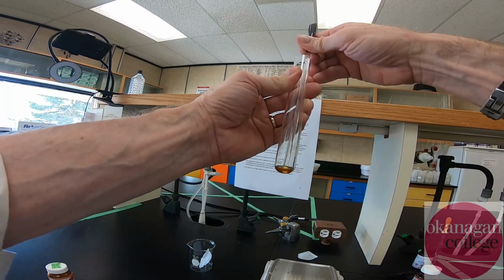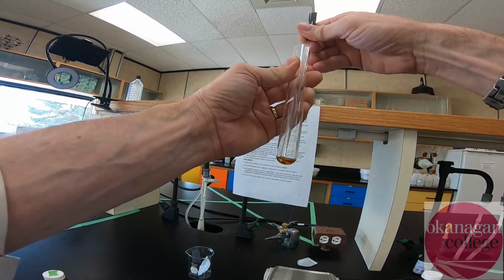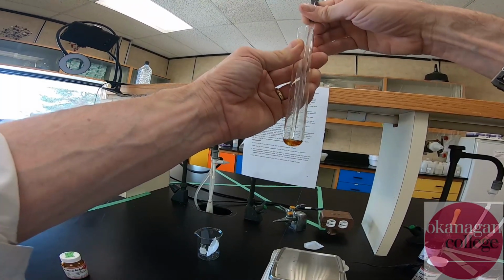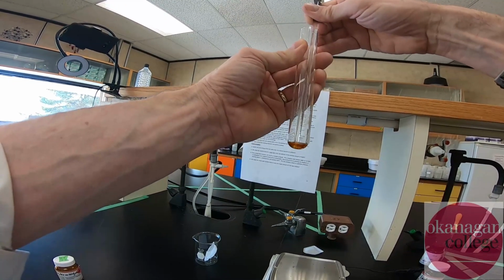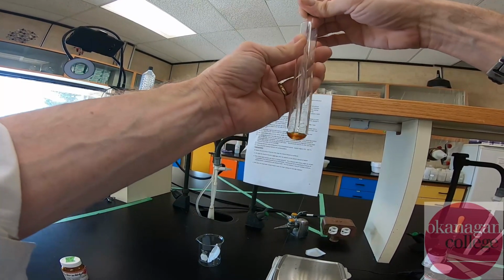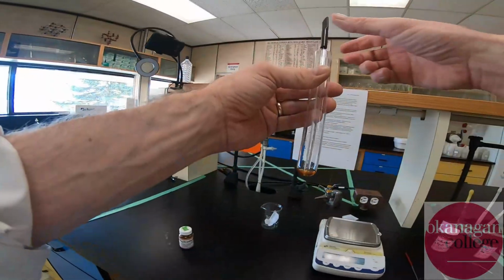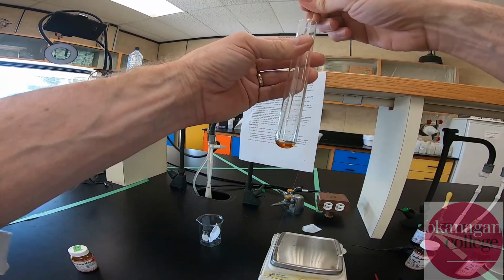We've got a clear brown oil with a small amount of solid material in the bottom of the test tube. It's important that everything be fully dissolved before we add the catalytic sodium hydroxide. It gives everything a chance to react. So we'll fast forward through some of this. It's a little tedious, but we do want to make sure that everything's fully dissolved in one another. Again, each compound acts as a co-impurity. We're almost there. Okay, so that's probably the better part of 10-15 minutes, and we do have everything nicely dissolved.